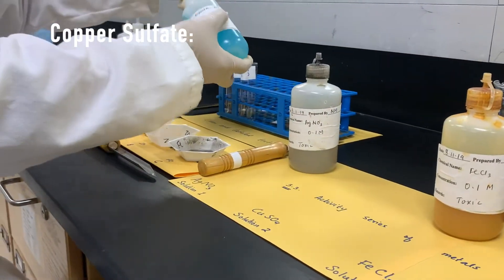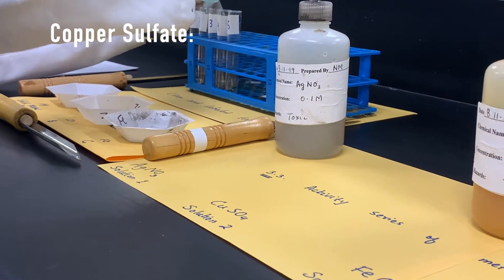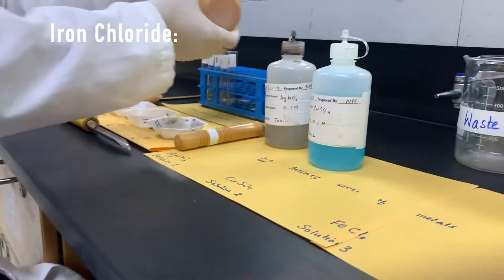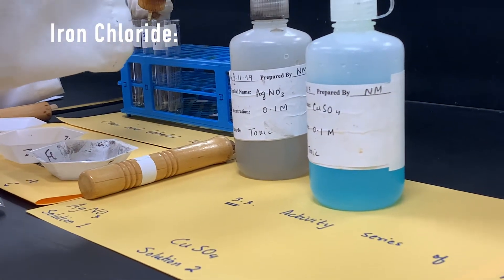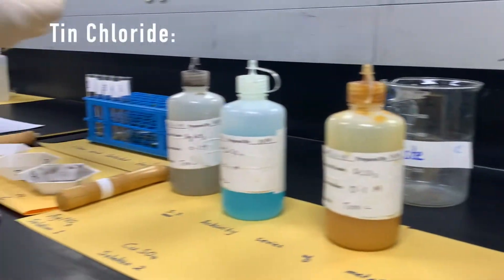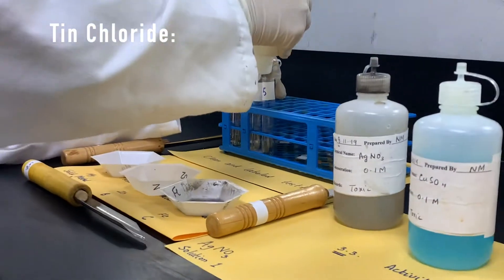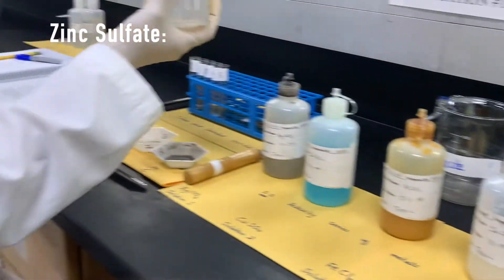Then copper sulfate in test tube number two. Iron chloride in test tube number three. Tin chloride in test tube number four. Zinc sulfate in test tube number five.